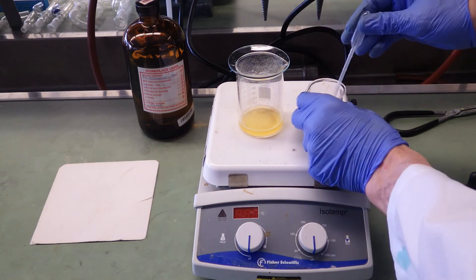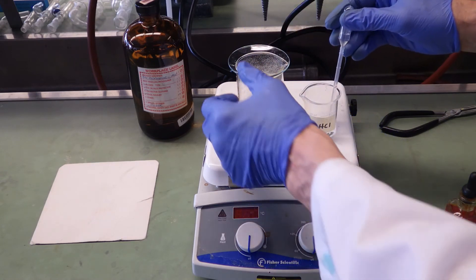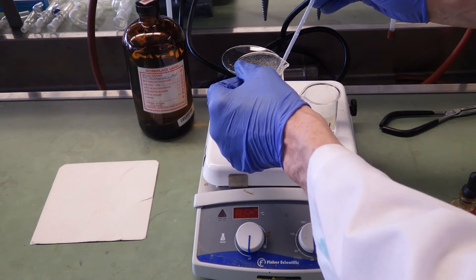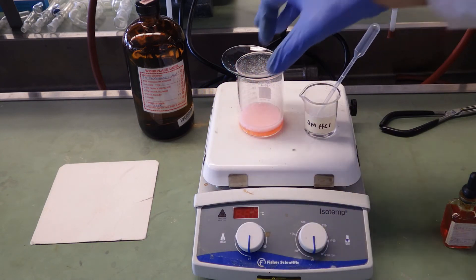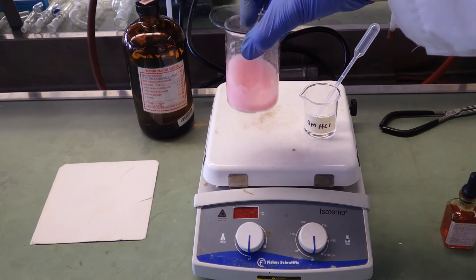As we get closer to the end point, the red color will persist longer and longer. When we reach the end point, then the solution should stay red.